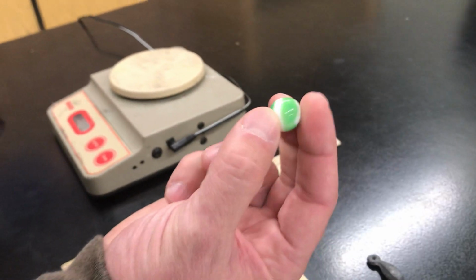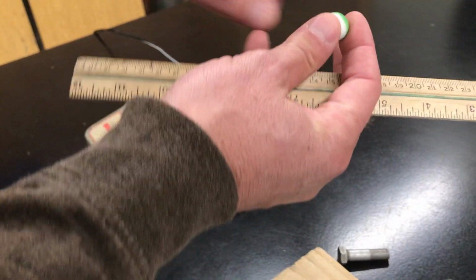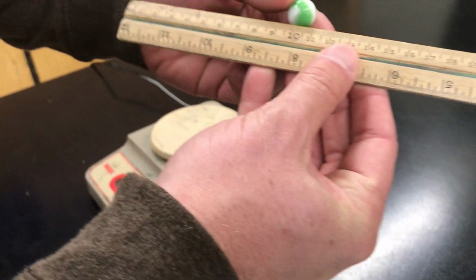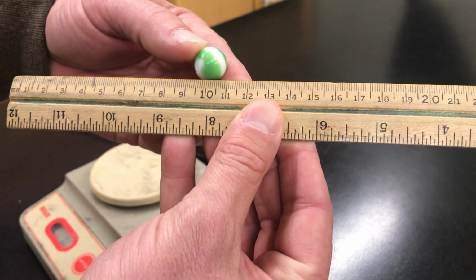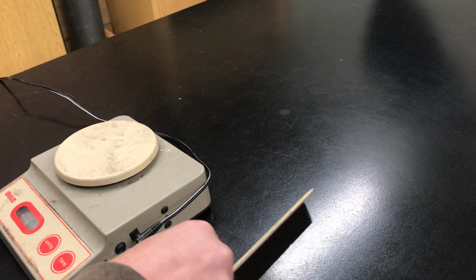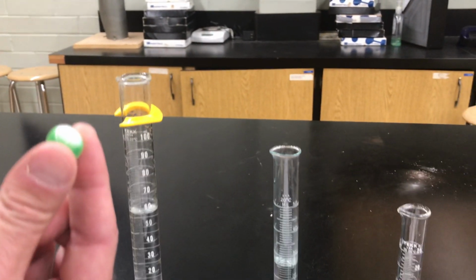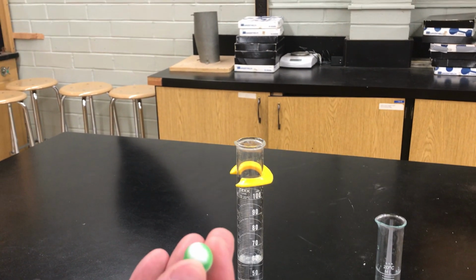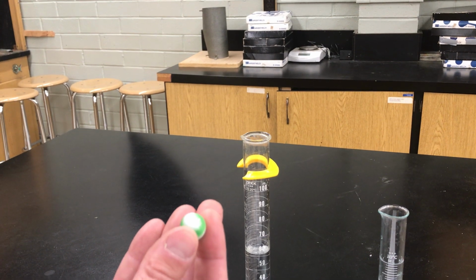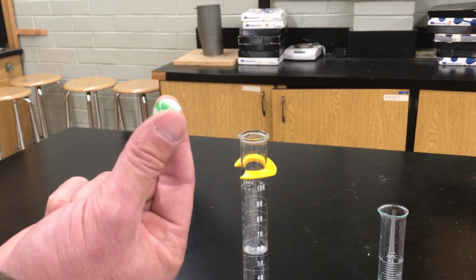Okay, so the first thing we're going to do is we're going to try to measure the density of a marble. So I'm going to take a look at this marble. Right now, that's a sphere, and that's a nice geometry shape, but if I were to try to measure this, that's kind of hard to tell, like how far across. What's the diameter of that sphere? I'd have to eyeball it. So we're going to use a different method. We're going to use a method called water displacement, okay? If I drop this into some water, it's going to sink to the bottom and it's going to push that water level up. If I can figure out how far the water went from the beginning to the end, how far up it went, it would tell me how much space this takes up.